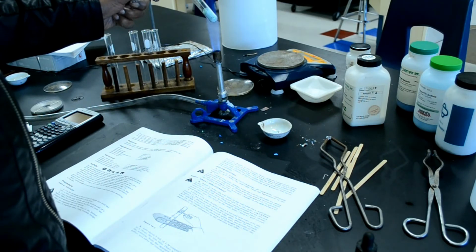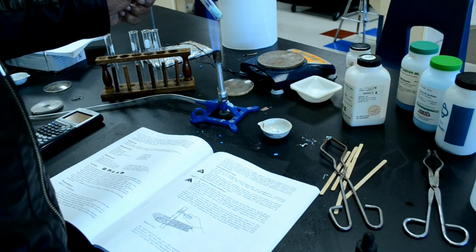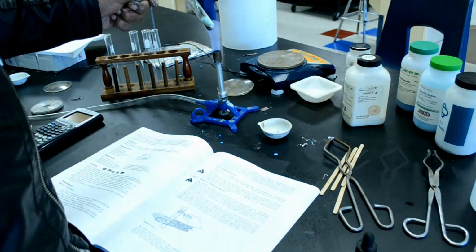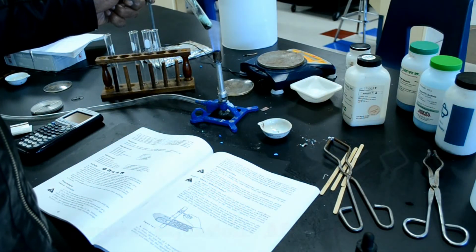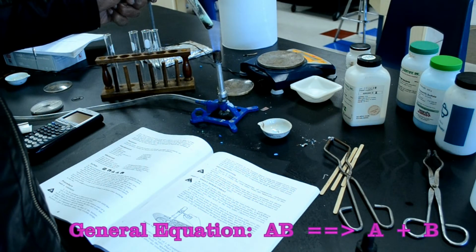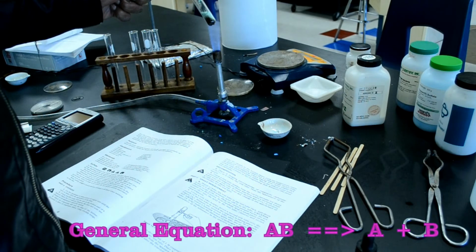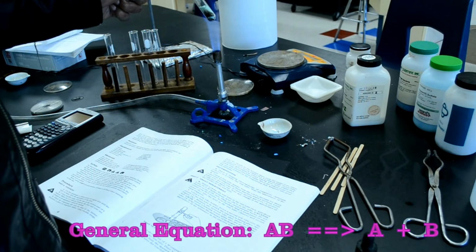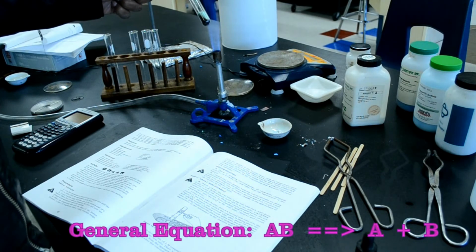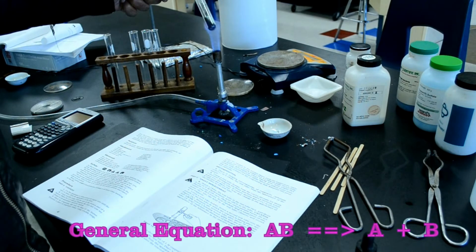Then it says, extinguish the flame and insert a burning wood splint into the test tube. If carbon dioxide gas is present, it will put the flame out. Note any change in appearance of the residue in the test tube. Well, we can see that the sample is actually turning black.